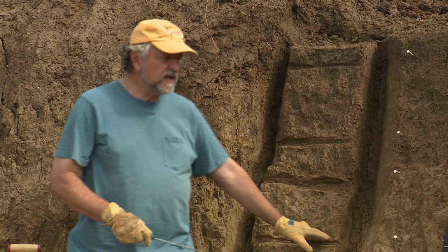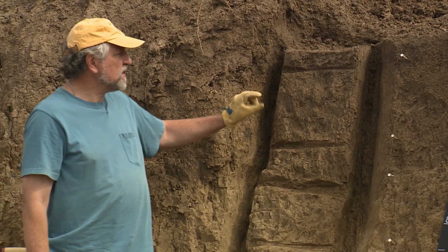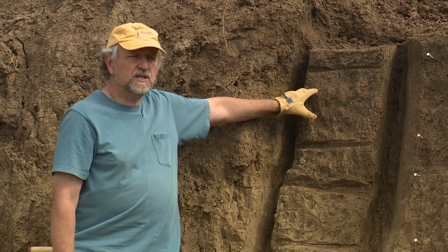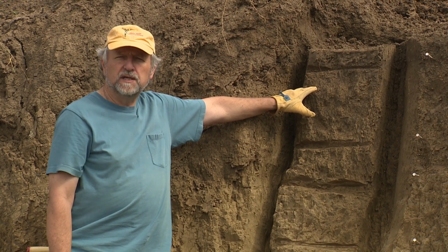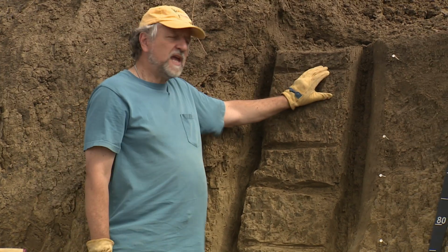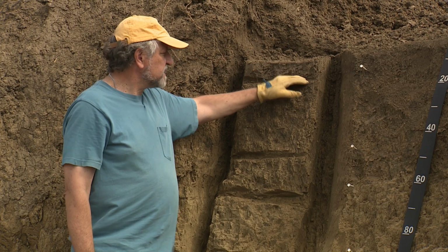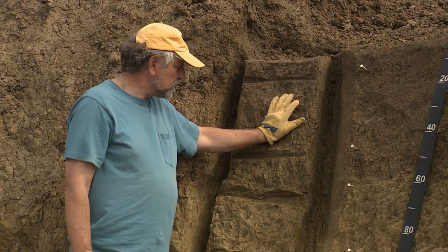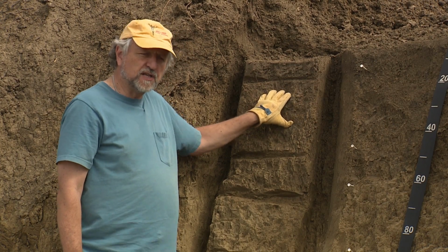We're going to excavate these zones, and I also wanted to point out that if you have very thin layers, this method is not appropriate. You simply cannot get a large enough chunk for a bulk density clod. But if these layers are thick enough, we're going to excavate out each one and get 3 or possibly 5 clods from each layer.